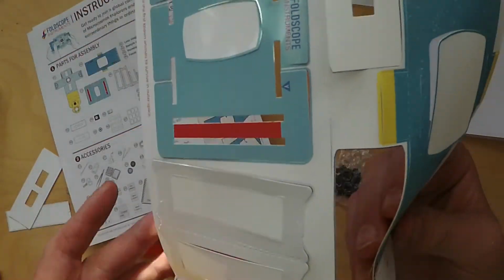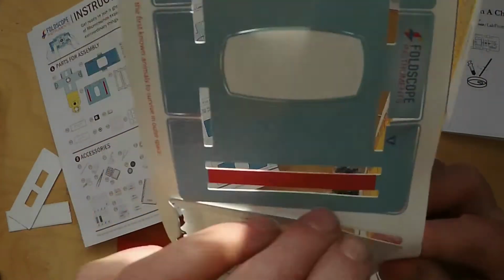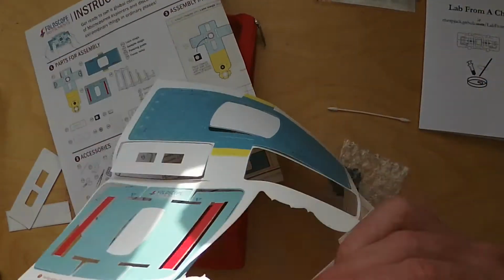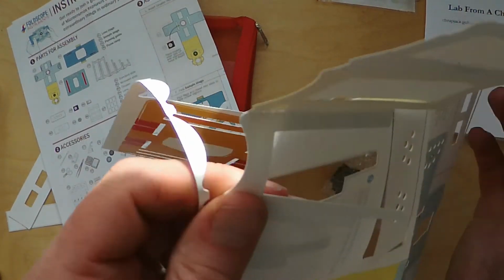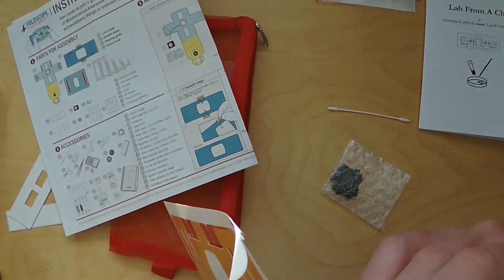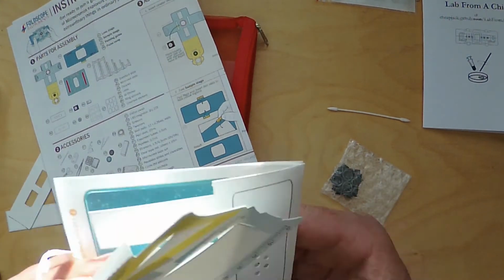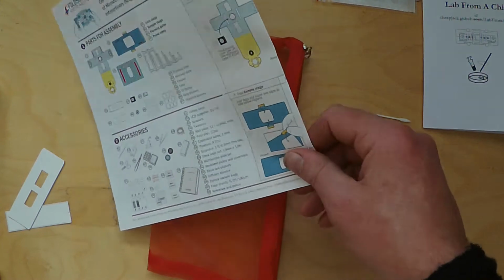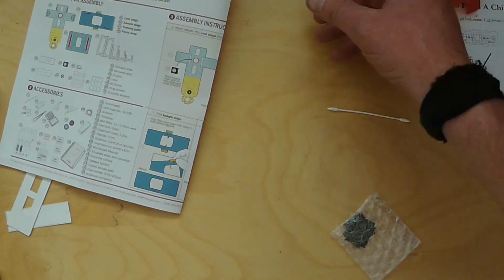Okay, so for example, your lens stage, your focus ramp, you just pull that out of the net. Don't worry too much, it keeps up everything. And don't be too rough with it, and you actually end up with a completed set of components. So I've done that section earlier, so what you'll end up with once you've taken all the components out, let's put this to one side.